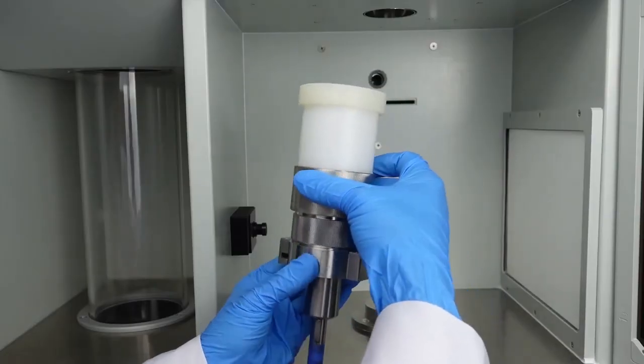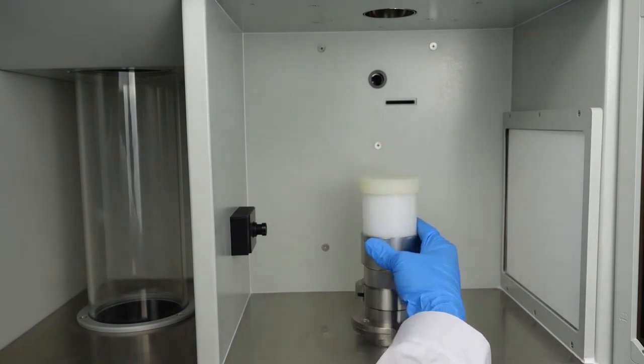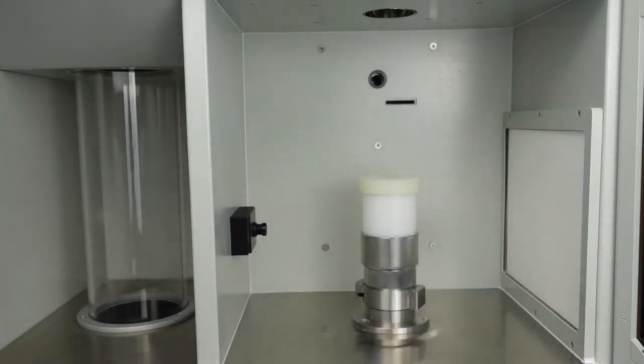Install the tap density cylinder assembly on the base, and then put the tap density assembly into the hole at the designated position.